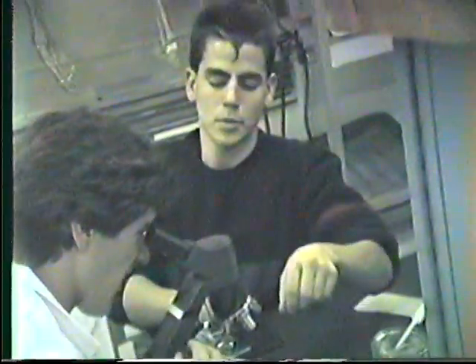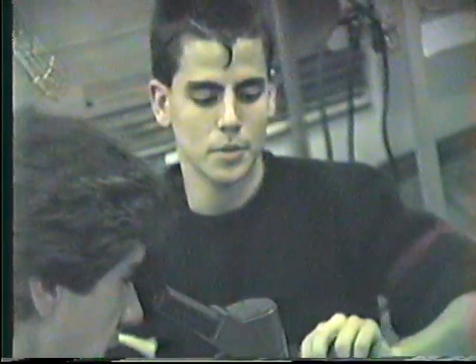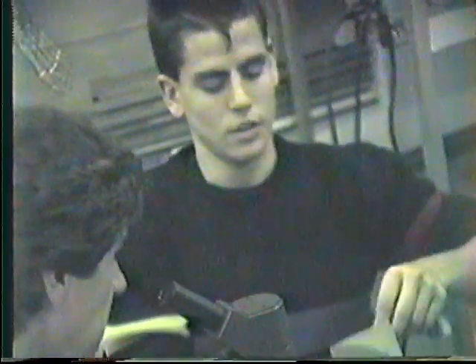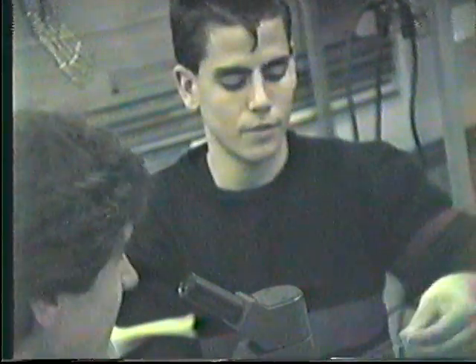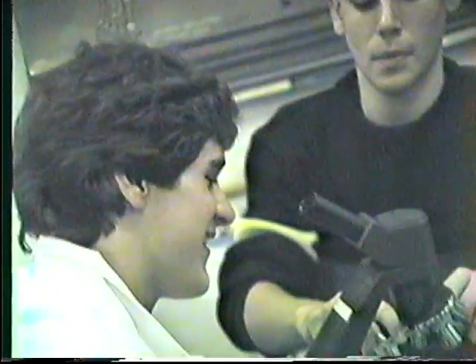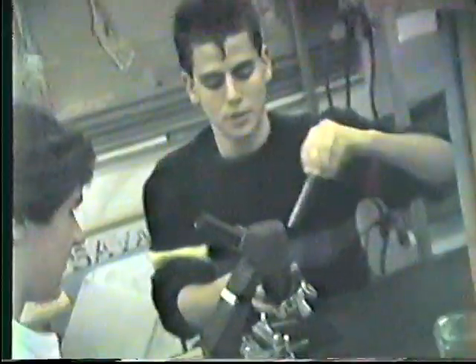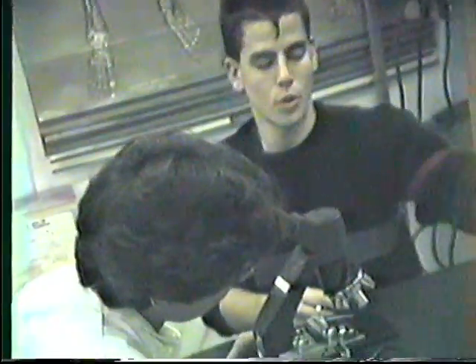Organisms in the middle of the lake appear to be few. It's very sparsely populated because of the variation in temperature. So the shore sample, which the temperature is a little bit warmer, and there's a lot more vegetation on it, so there should be more living on the shore.